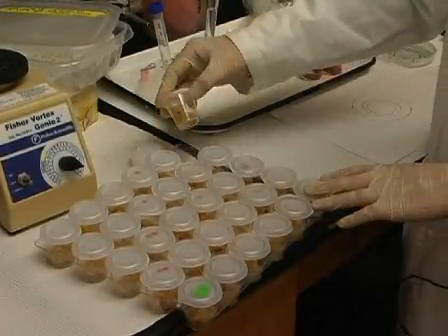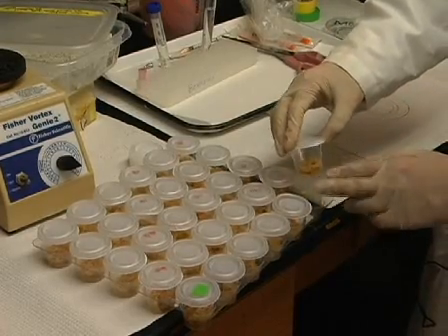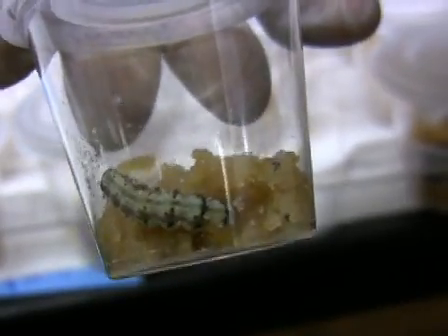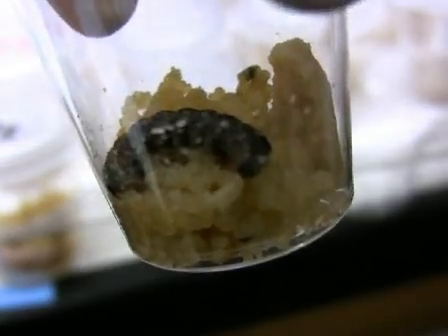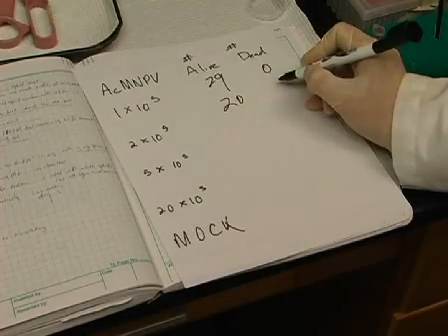When using this bioassay to determine lethal dose, the larvae should be checked every 2 to 3 days until the mock-infected larvae and any surviving virus-treated larvae have pupated or have begun to burrow in order to pupate. Virus-infected larvae will remain on the top of the food and then die. After a few days, dead larvae will sometimes melanize and turn black. Larvae that die from infection essentially become bags of polyhedra, which will completely dissolve if mechanically disturbed. At this time, score the larval mortality in each treatment.